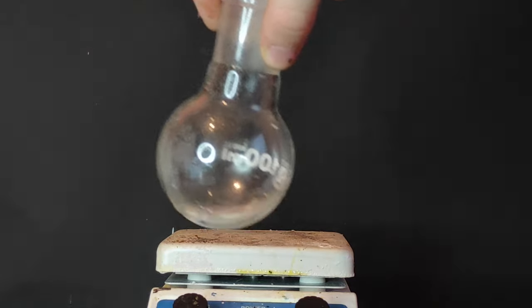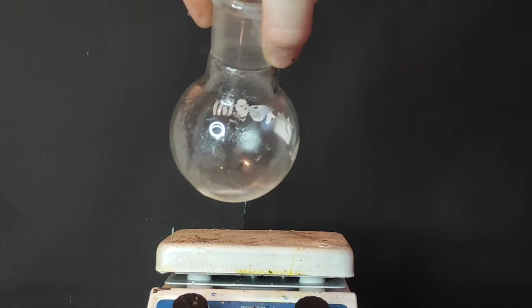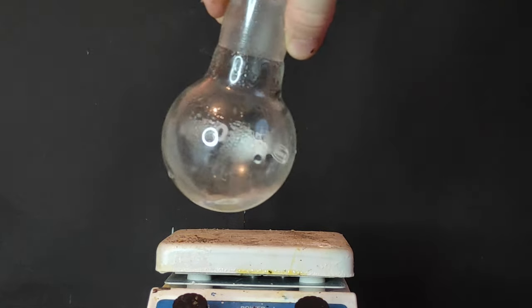After I came back, all of the ether layer was gone and there was some ugly brown stuff at the bottom. However, you probably can't see it on camera.